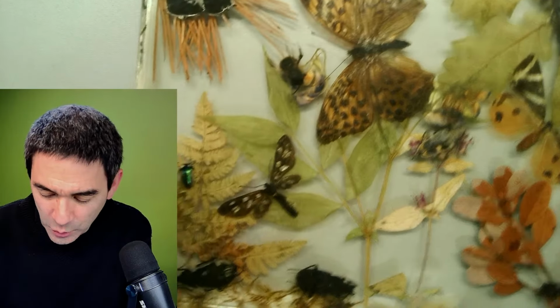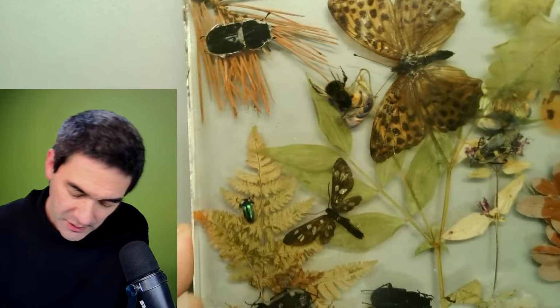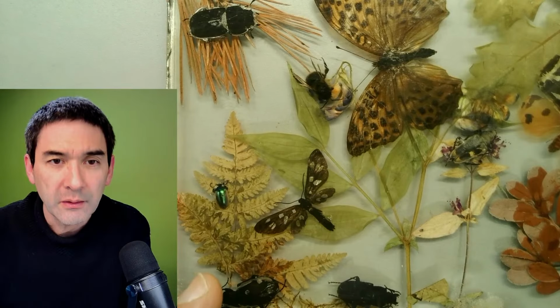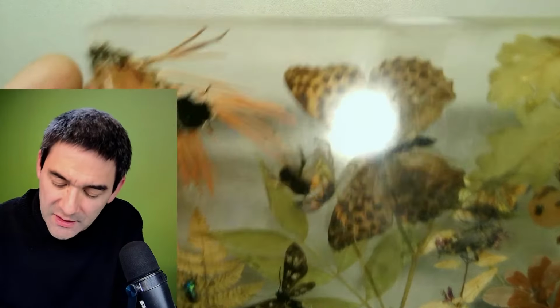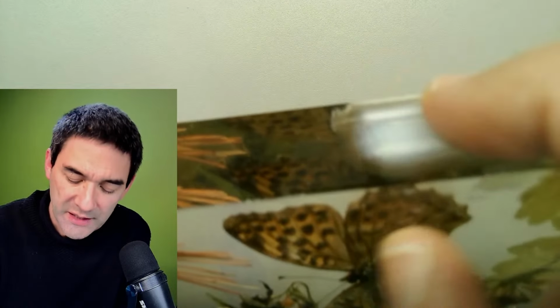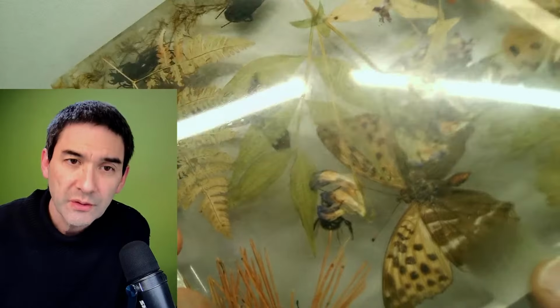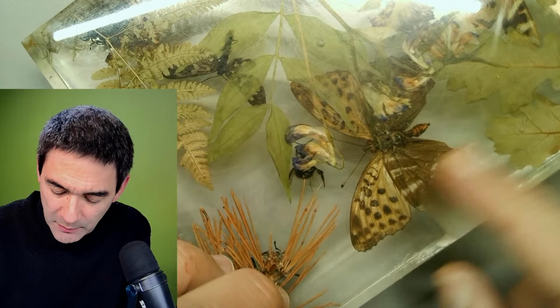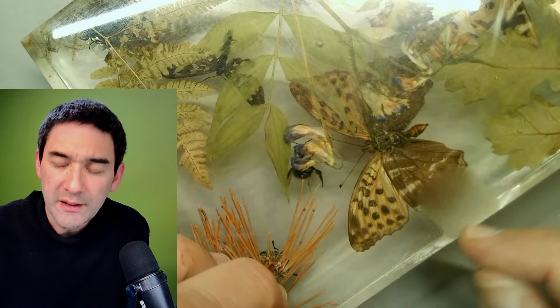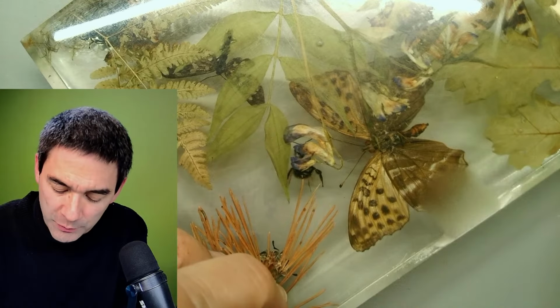It's from when our school was founded, which must have been back in the late 1970s or so. It looks kind of nice. However, there's something interesting here, and I've seen this with several of these. You see this whitening. This is where a tape was connected, and also over here. So some of them will turn white with time, and apparently this is some kind of oxidation process.